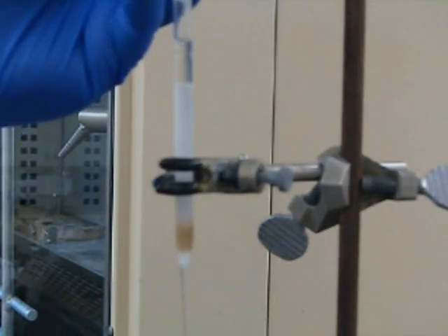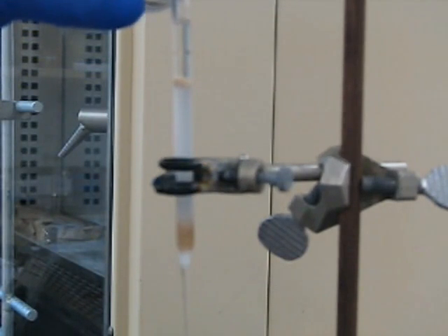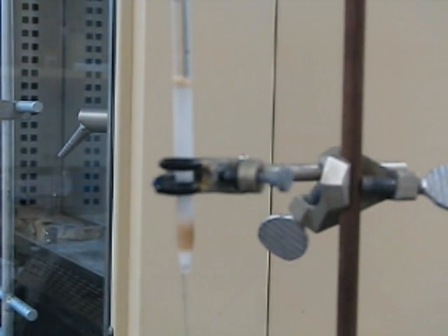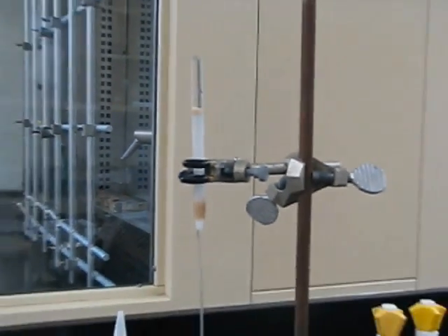So we're going to add a little more sand. Top it off. And again, that's just for when you add subsequent things to the pipette column, the silica stays flat. Any interference will happen in the sand, which you can just tap and level out.